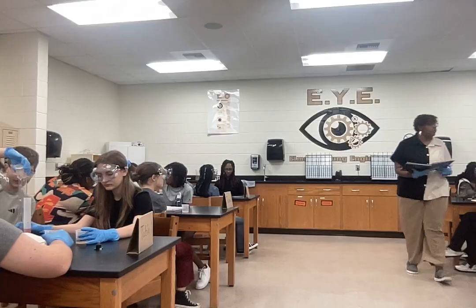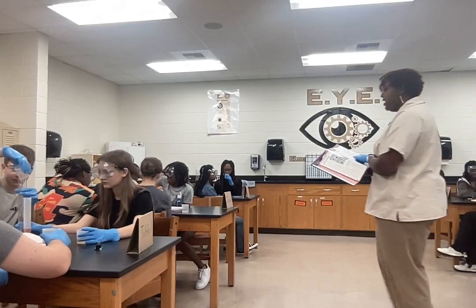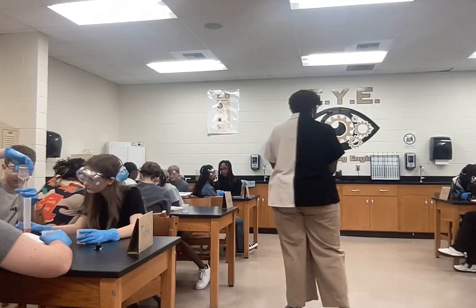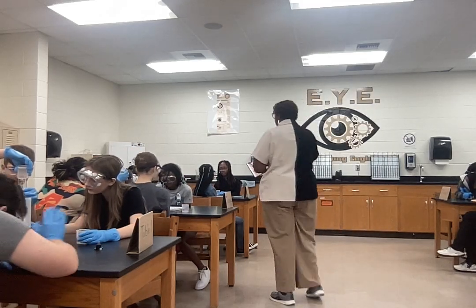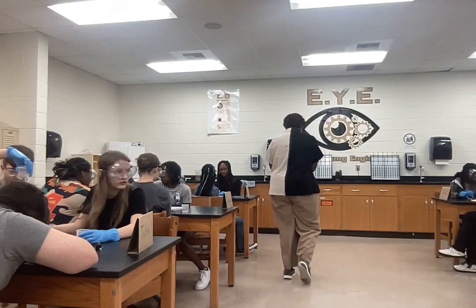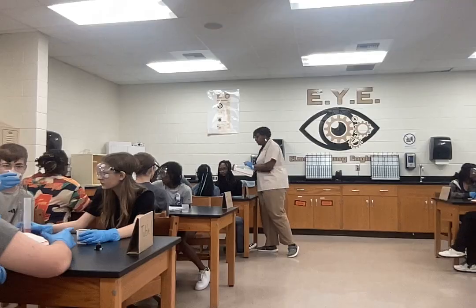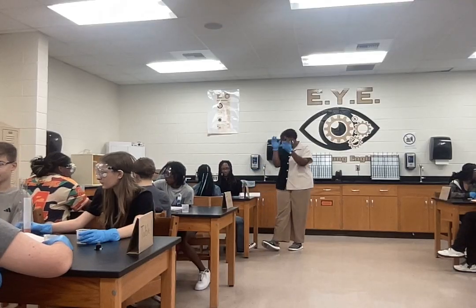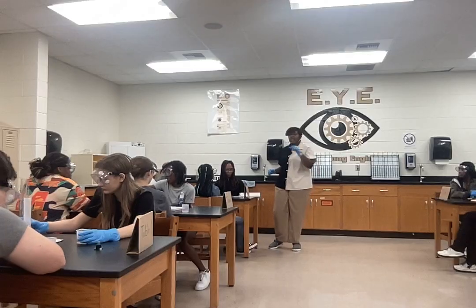All right, after you have finished with the corn syrup, good job. After you have finished with the corn syrup, then can someone read step number 6? After 25 milliliters of corn syrup, who's going to read number 6 for me? Step number 6. Taylor. Next, add. All right, quiet down so we can hear Taylor.